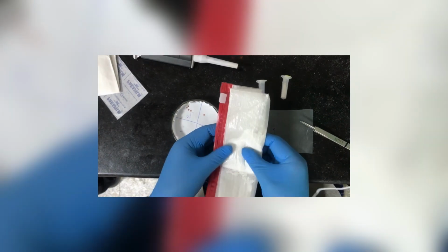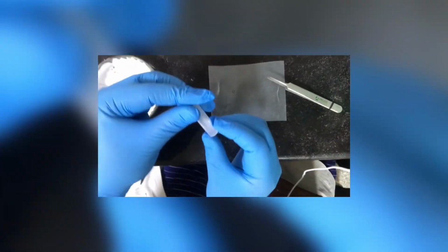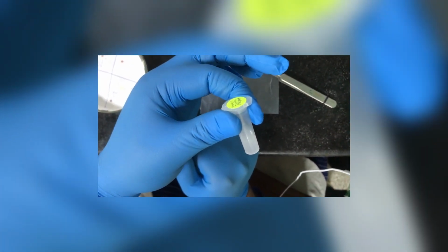This is the powder sample which we have to investigate. This sample has been properly dried, and this dried sample has been suspended in alcohol, ethanol, till it is slightly turbid. It is important to keep it slightly turbid.